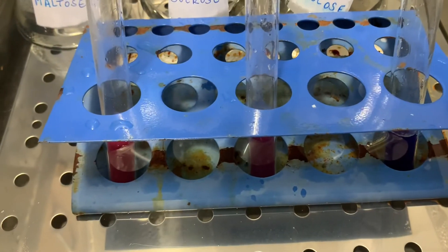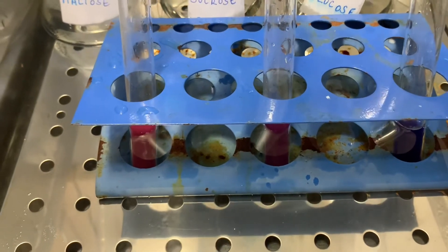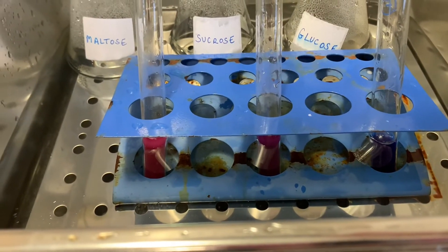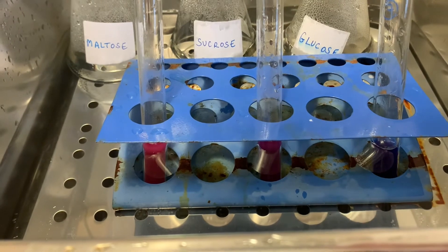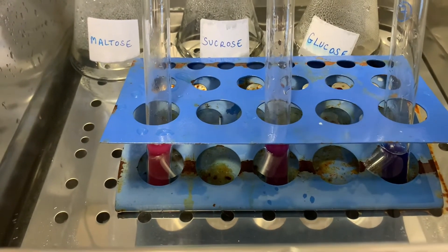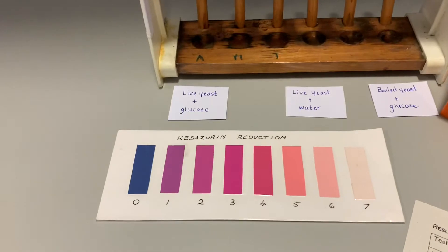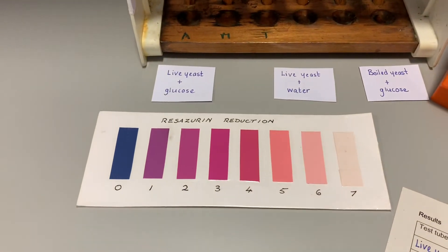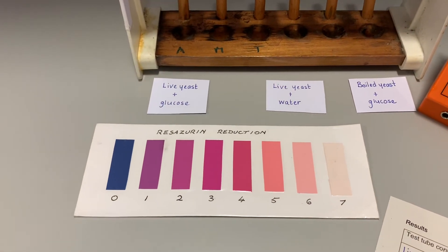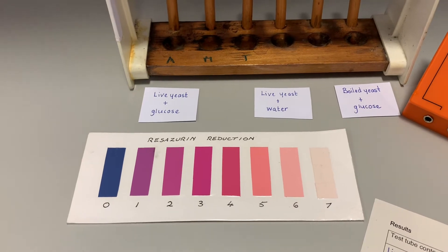At the five minute update you can see that test tube A is much lighter in color than the others. It's starting to look very pink, and if you have a look at the color chart, that's somewhere in the middle between no hydrogen and lots and lots of hydrogen.